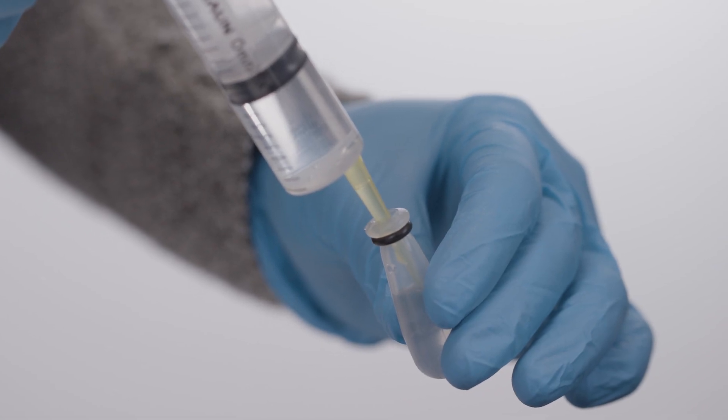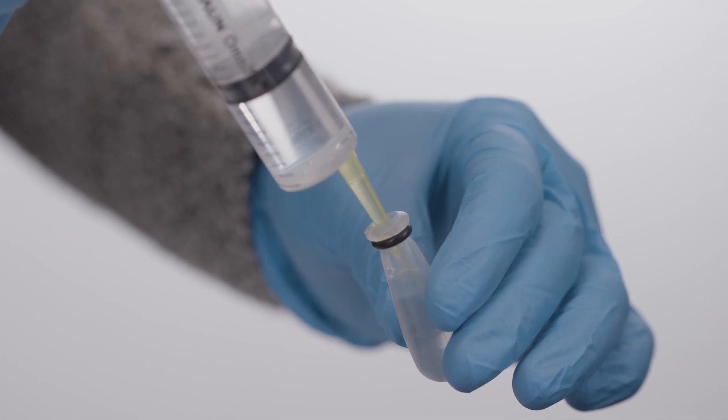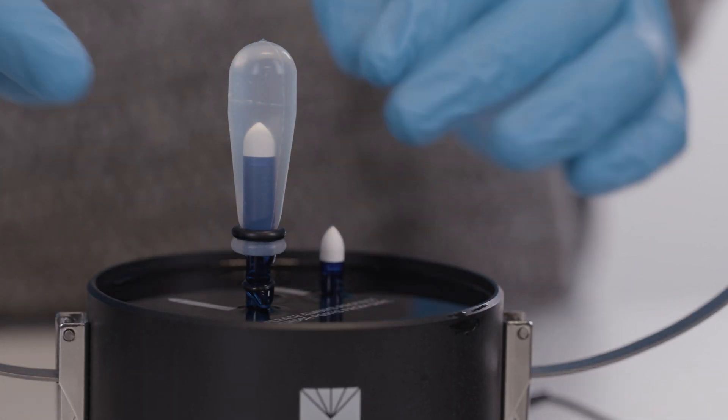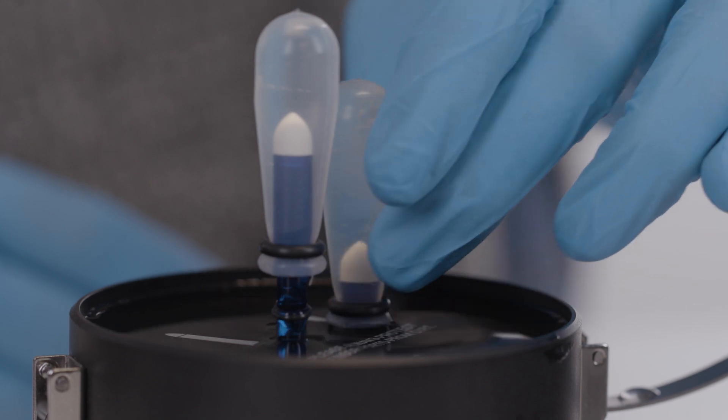Fill a silicone cap with distilled water. Place the silicone cap on the tensio shaft to keep it wet. Repeat the previous steps for the second tensio shaft.